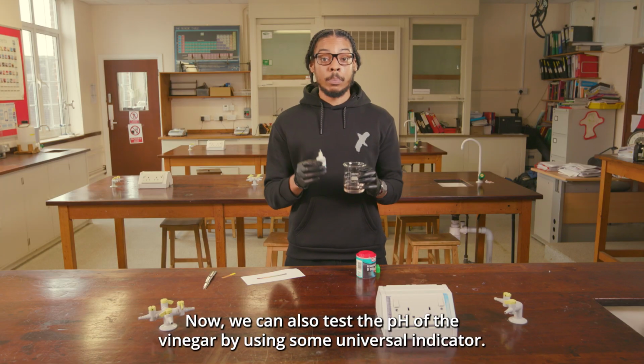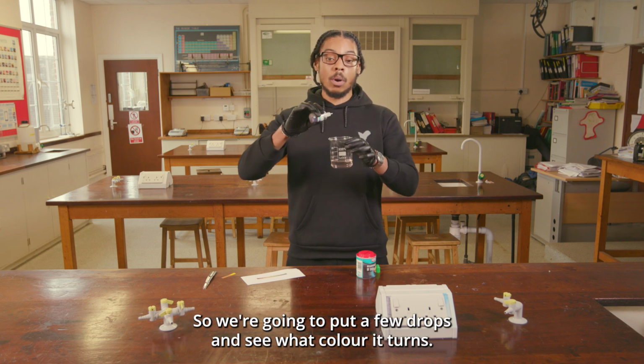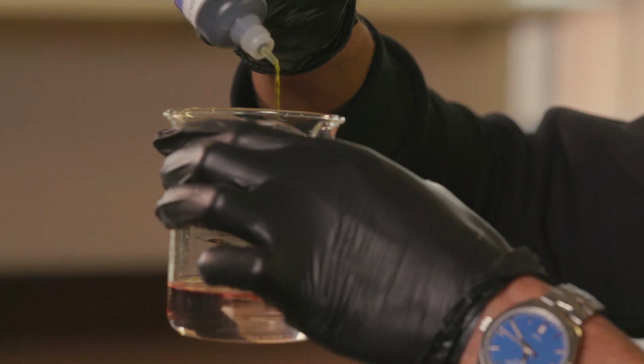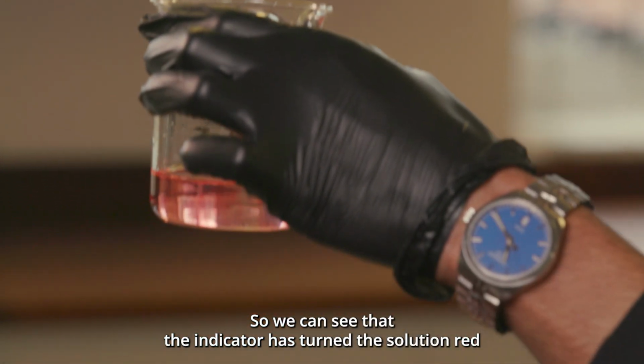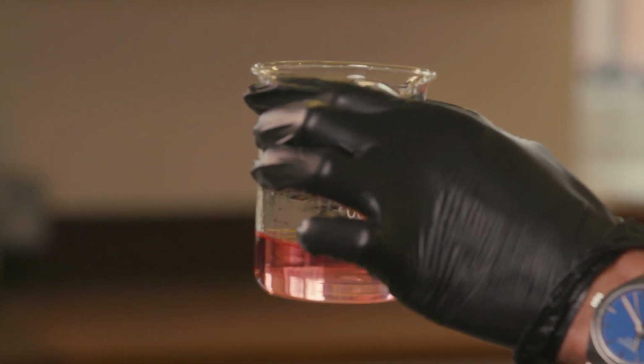Now we can also test the pH of the vinegar by using some universal indicator. So we're going to put a few drops and see what colour it turns. So we can see that the indicator has turned the solution red, and that gives us a pH of around 2 to 3 as well.